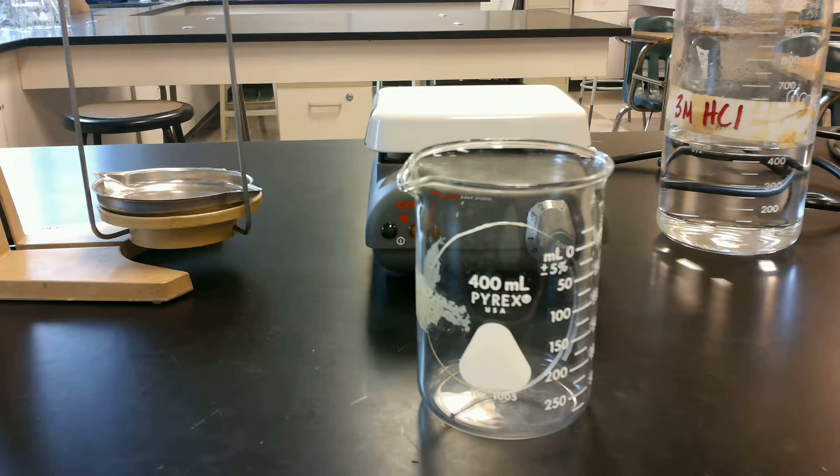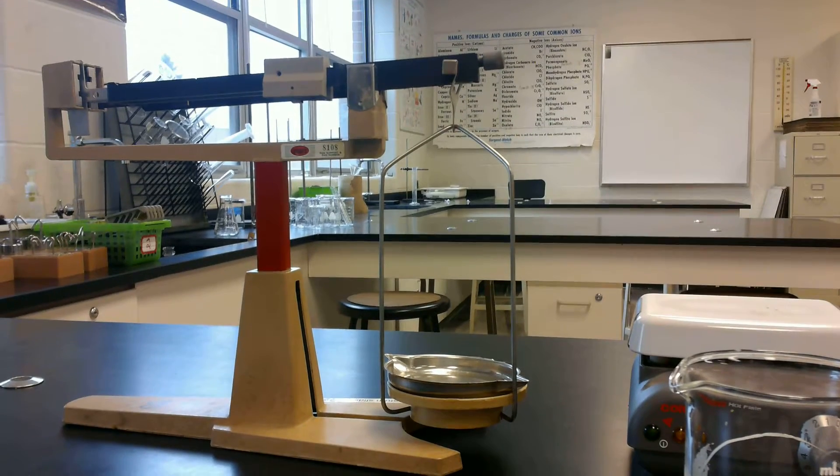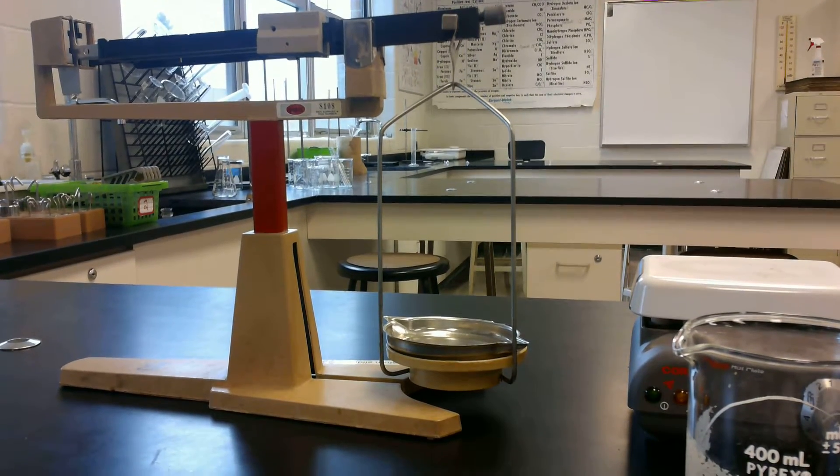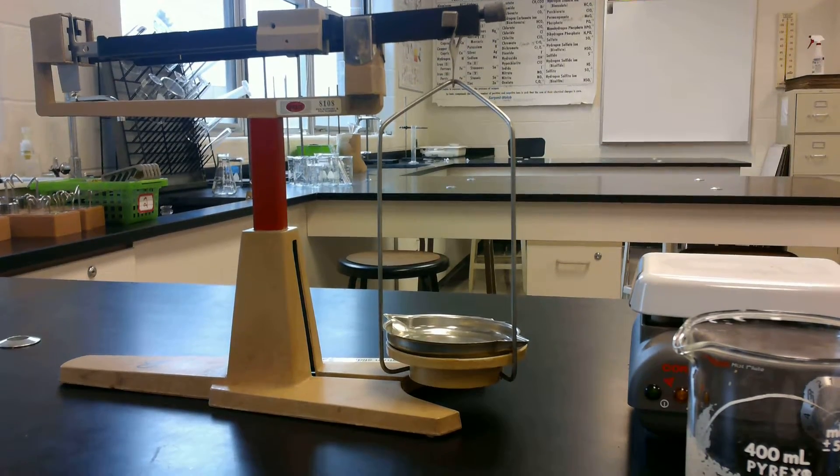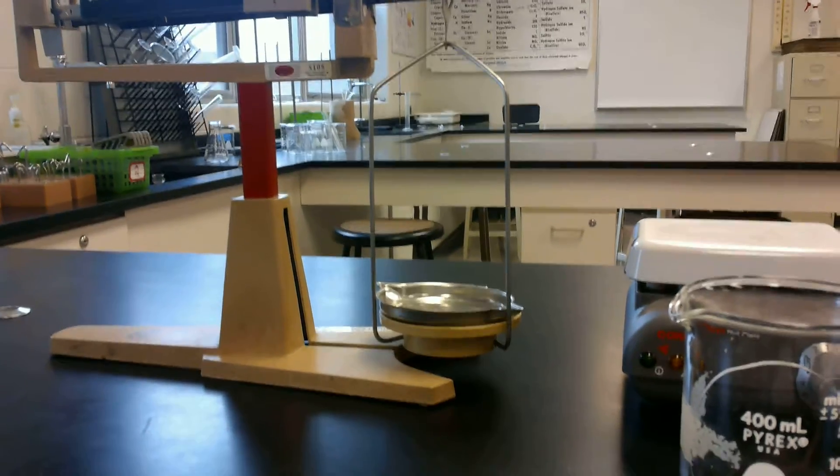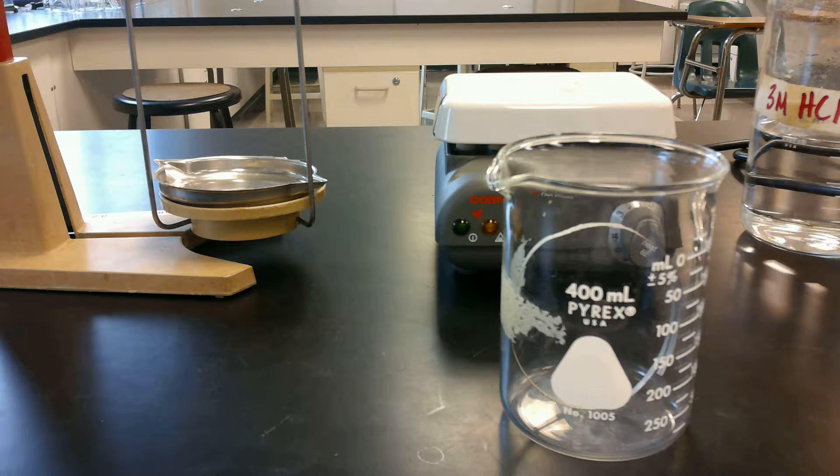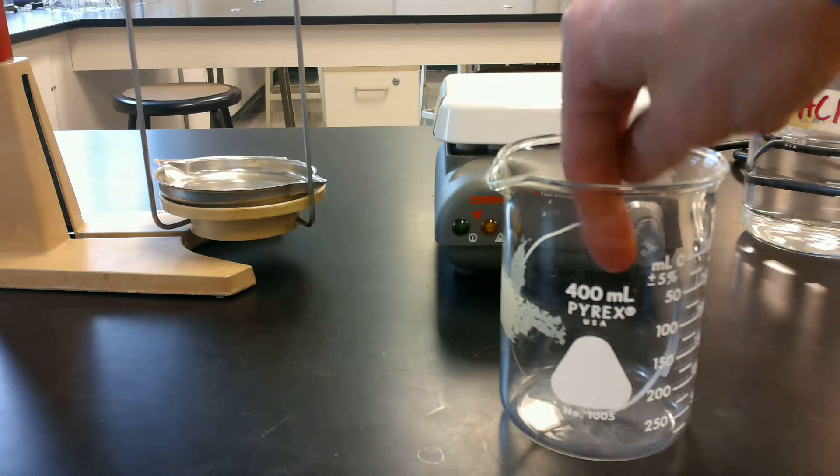because it's going to become a part of the mass. And so once it's labeled, I'm going to very carefully record the mass with a triple beam balance. I'm going to obviously calibrate it first. This thing goes out to the thousandth place of precision. So all your answers are going to end out to the thousandth place, it's going to be either a 5 or a 0. An example would be 1.005. We're going to go out to that level of precision, and you're going to record that in a data table.